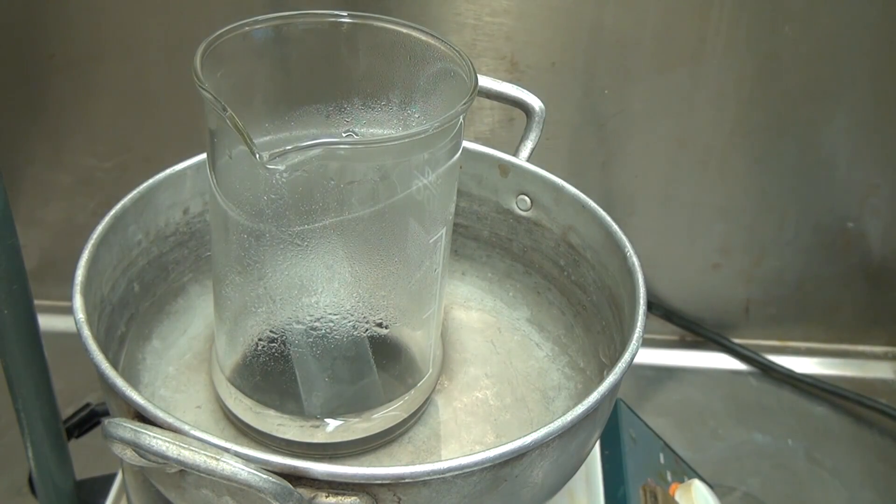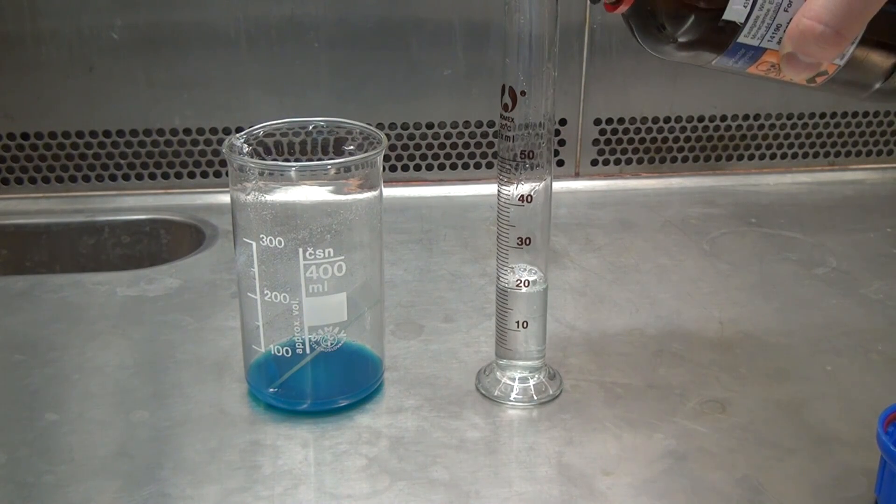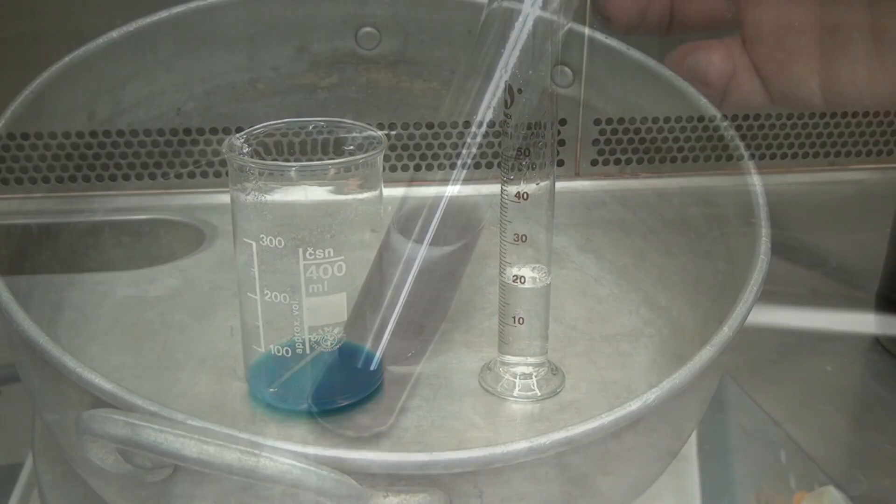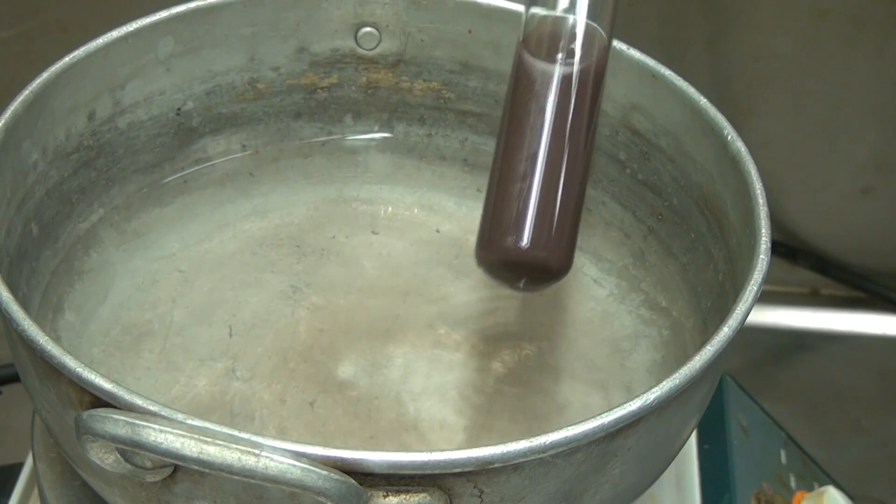I've tried to make this experiment but unfortunately that attempt resulted in a failure. Some of my chemist friends also said that the experiment with formaldehyde copper mirror is very rarely obtained successfully.